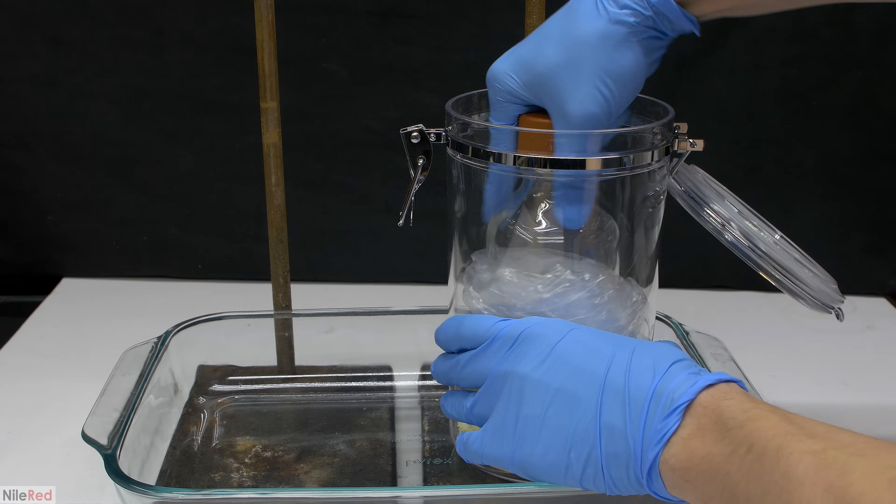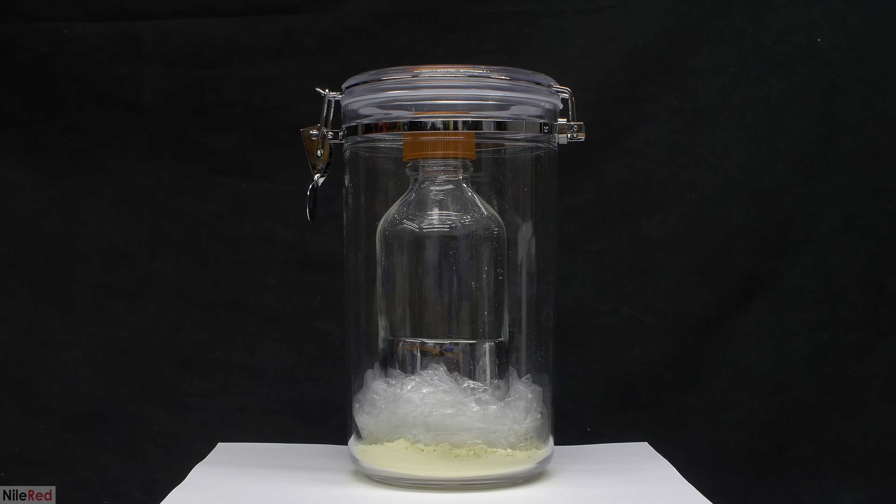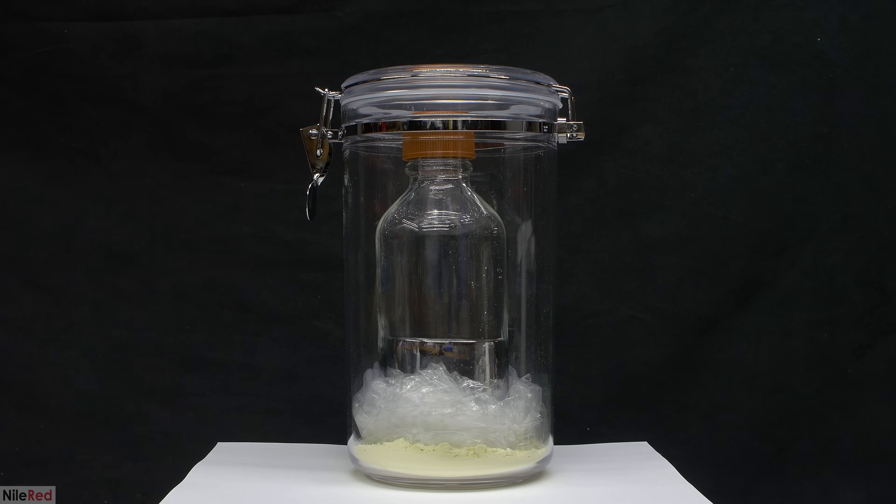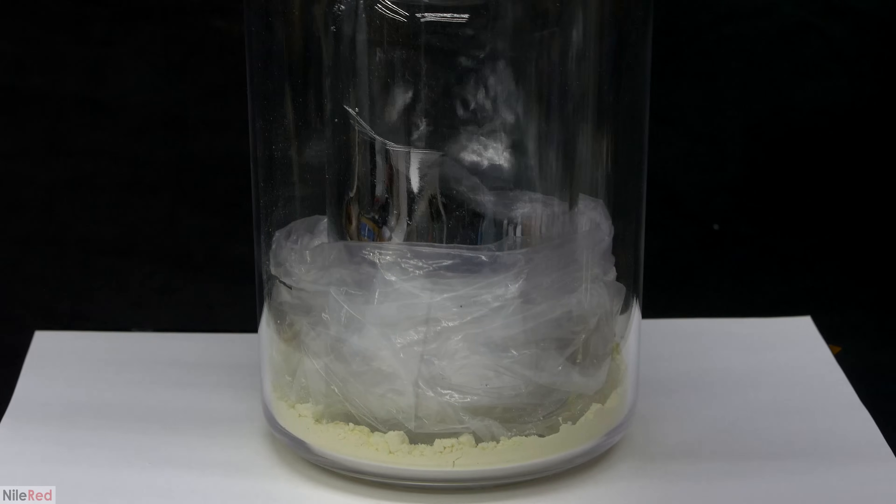Just so I didn't dirty the bottle up with sulfur, I made a small plastic bag sleeve. The bottle of mercury was placed into the container, it was snapped shut, and I'm pretty much done at this point. It's really recommended to use a plastic or steel container instead of glass because glass can obviously shatter. However, I found that the mercury looked much nicer in this glass bottle, so I sacrifice safety for beauty. At some point in the future though, I'll probably invest in a nice clear plastic bottle. It's also recommended to pack the outer container with something like kitty litter to prevent the inside bottle from moving and to protect it from impact. However, again for purely aesthetic reasons, I wanted to be able to see the mercury, so I obviously didn't do that.